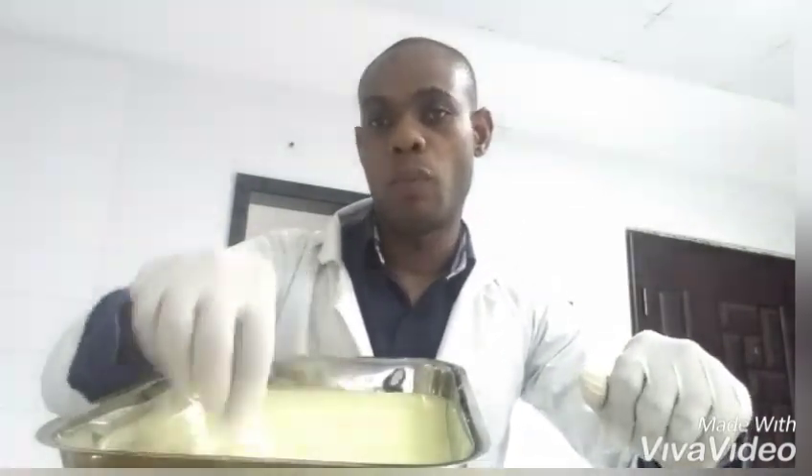Because you'll be cutting through the lizard, you're probably going to cut through some muscles in order to expose the internal organs. So you would need cotton wool, which will help you to clean off any blood found as you're doing the dissection. So right here with me, I have the sacrificial lizard — this is the lizard that we'll be using in this experiment.